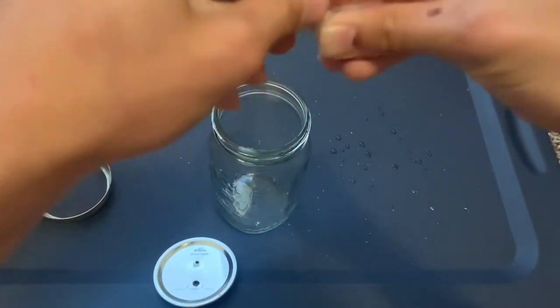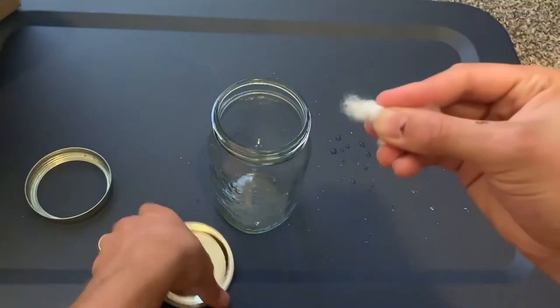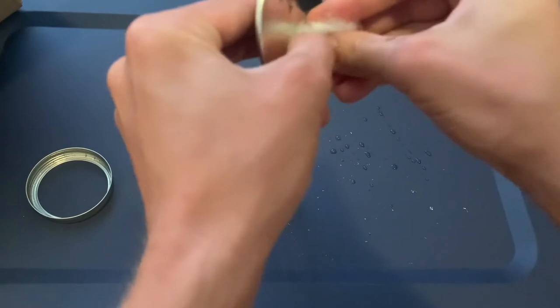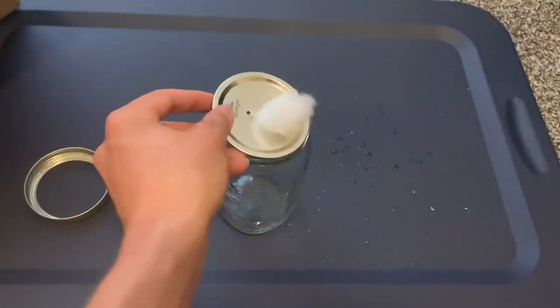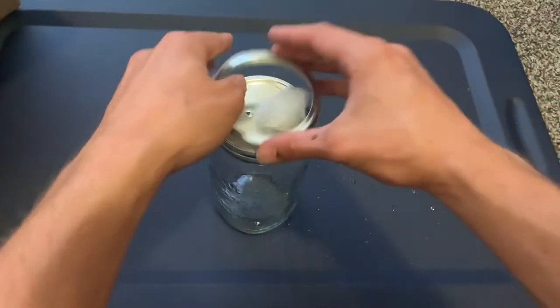The polyfill is going to be used as your filter, and you're just gonna put it through the bigger hole. It's kind of hard to get in there, so you got to twist it up a little bit, and then you can put your cap back on just to make this easier.